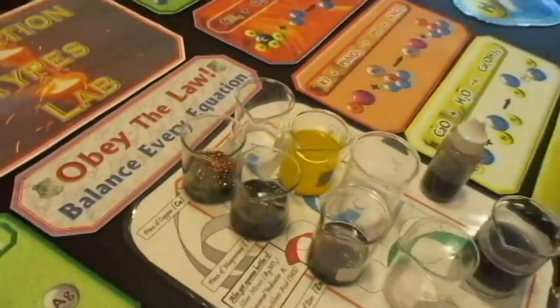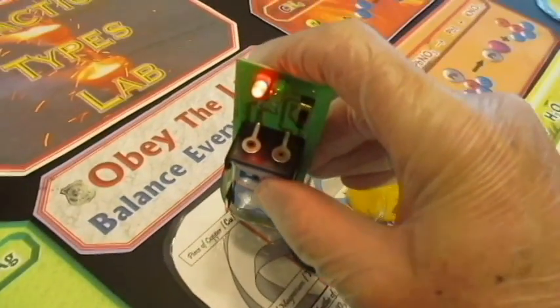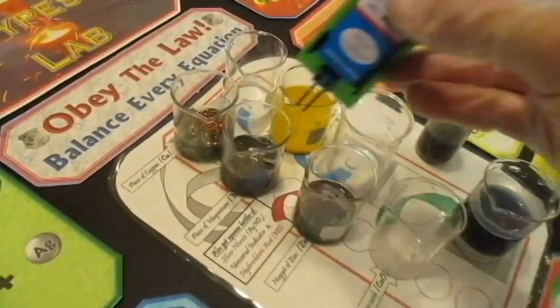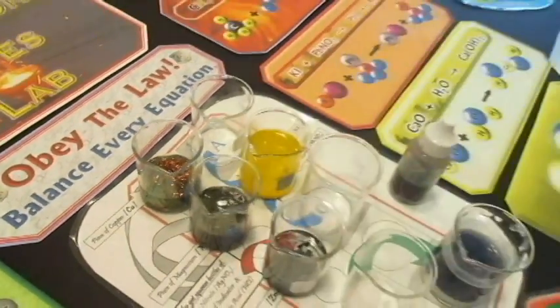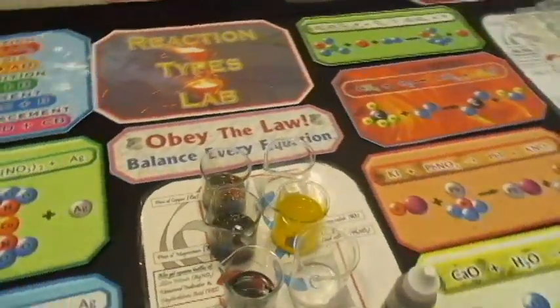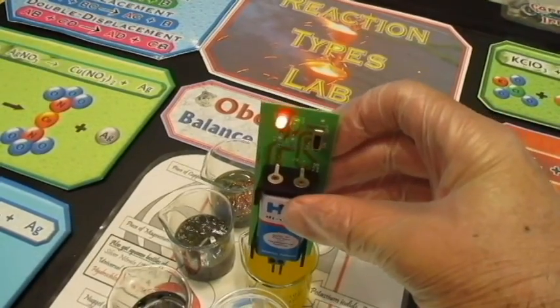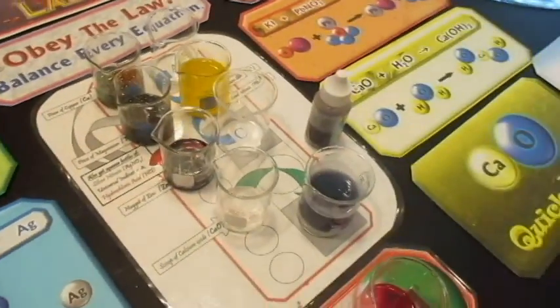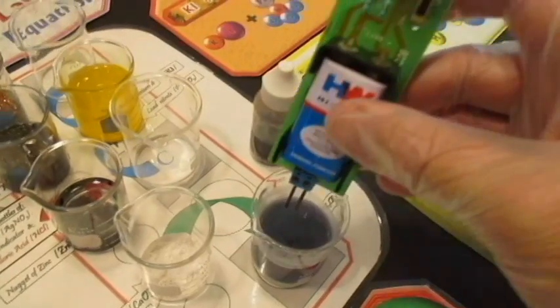Then I want to see the products of the second experiment. There we go. Okay, wipe that off as much as I can. And then the third experiment. Okay, wipe it off. And then the fourth experiment, I should be able to reach more easily here. Don't want to go too deep in there. Okay. And let's see our last experiment. Is this one right here? Let's see, does that conduct?